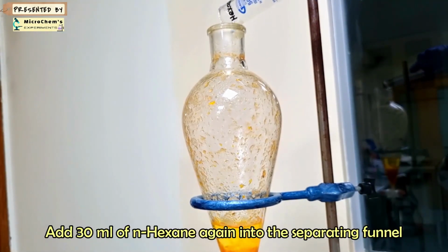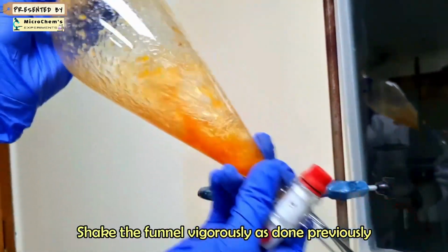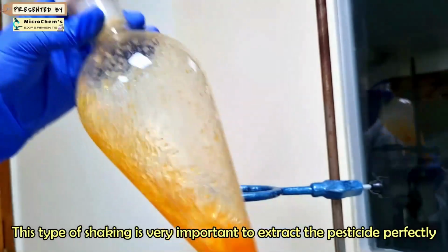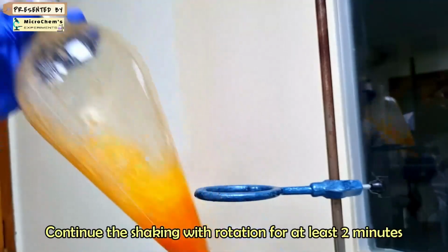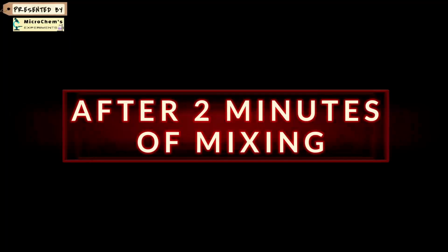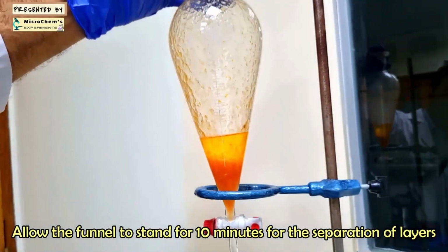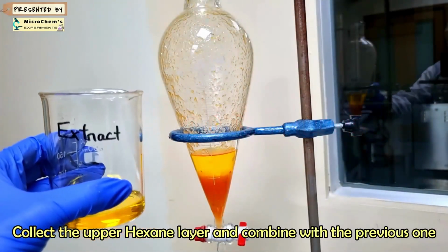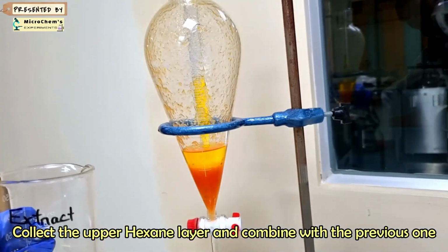Add 30 ml of n-hexane again into the separating funnel and shake for 2 minutes. Allow the funnel to stand for 10 minutes for the separation of layers. Collect the hexane layer as done before and combine with the previous extract.